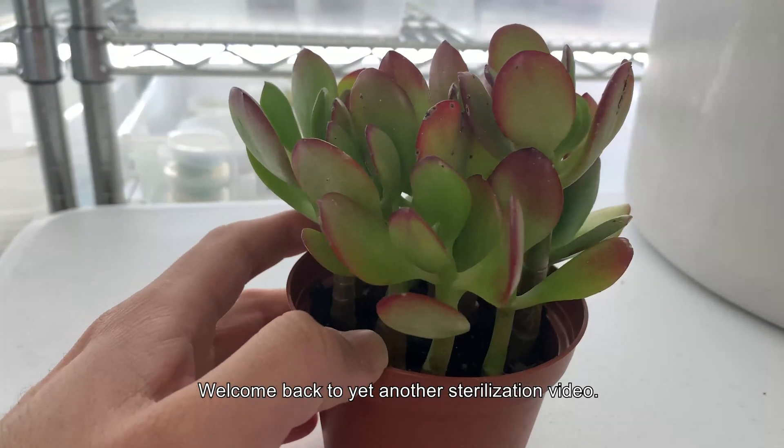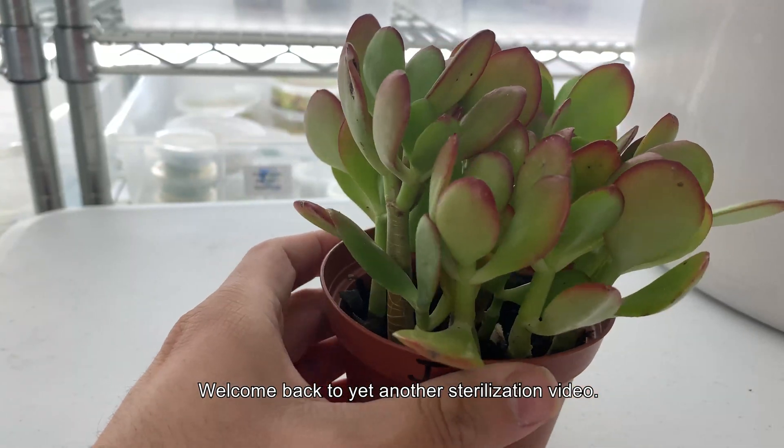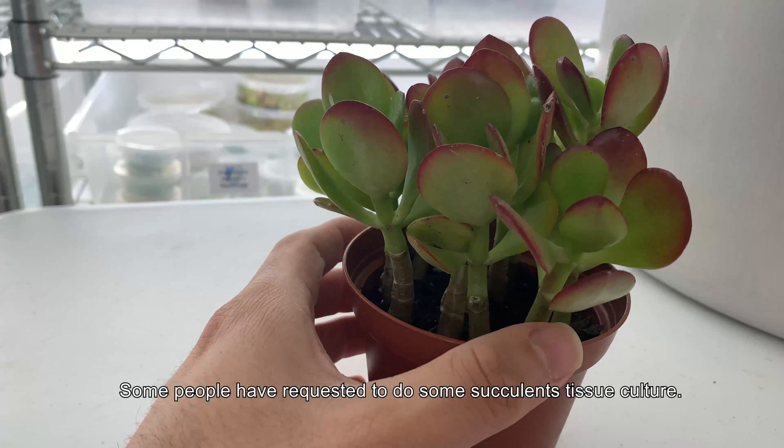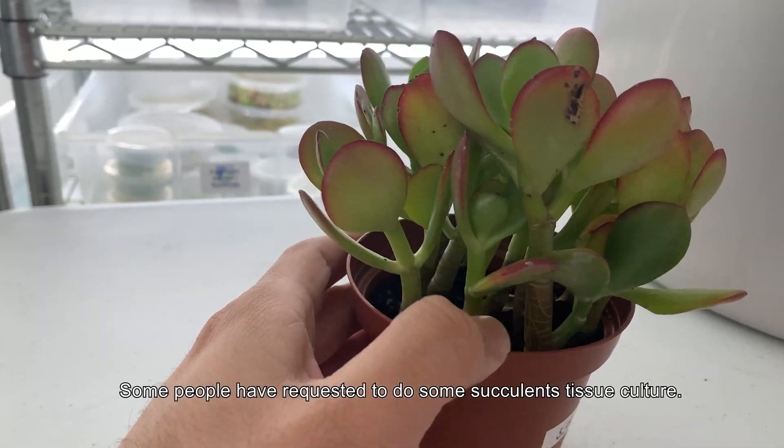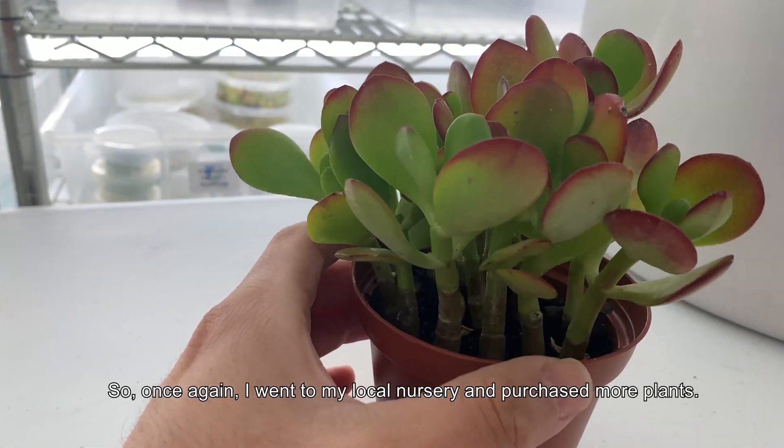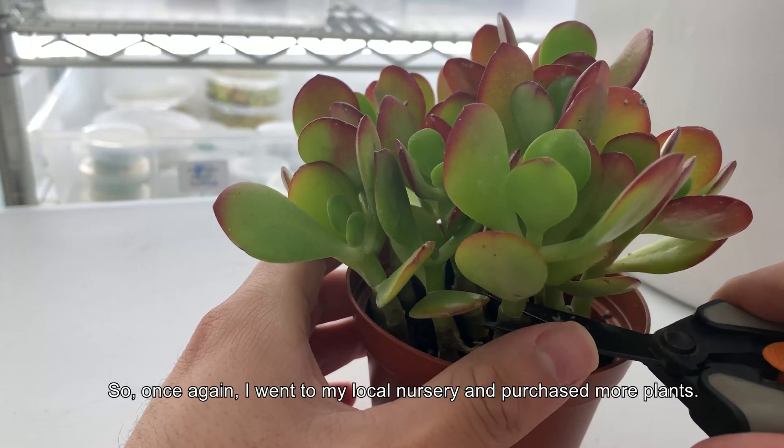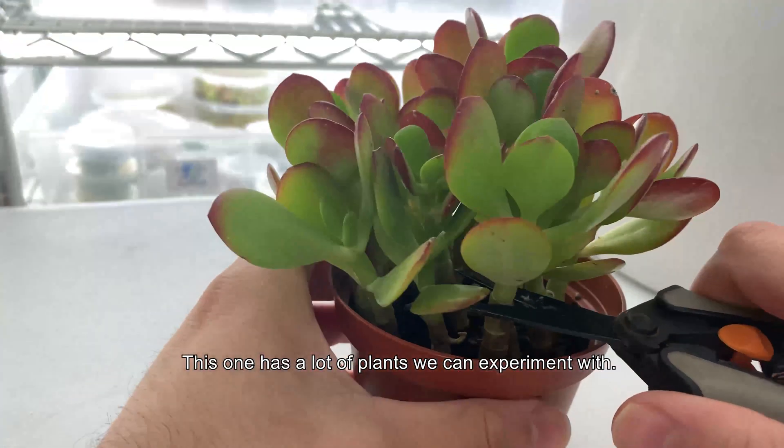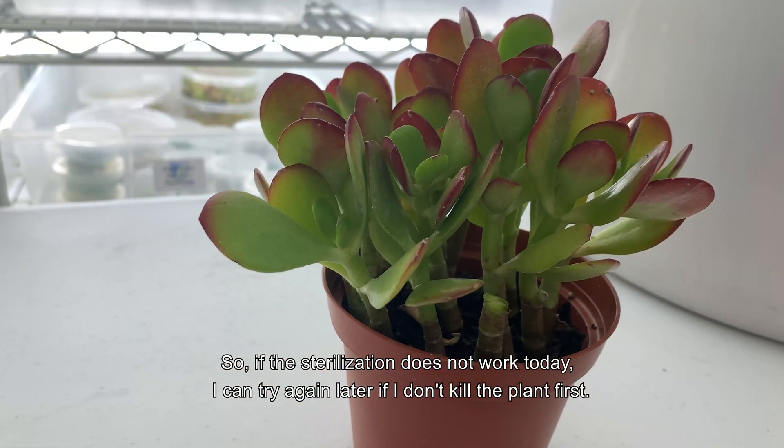What is going on guys, welcome back to yet another sterilization video. This time we are working with a jade plant. Some people have requested to do some succulents tissue culture, so once again I went to my local nursery and purchased more plants. This one has a lot of plants we can experiment with, so if sterilization does not work today, I can try again later.